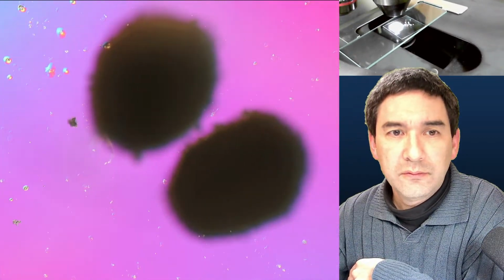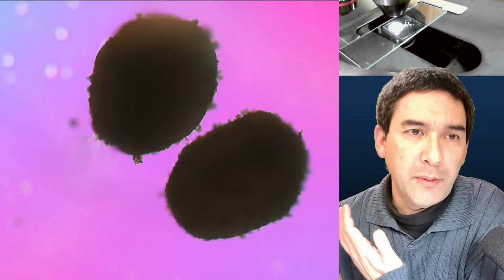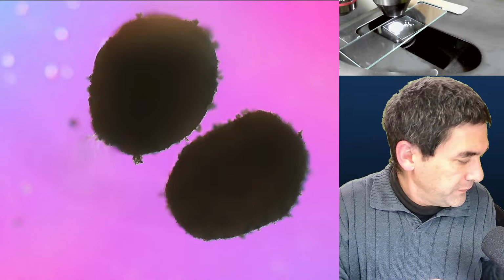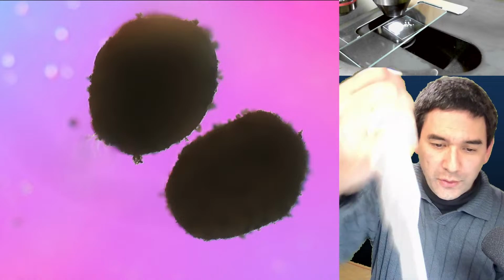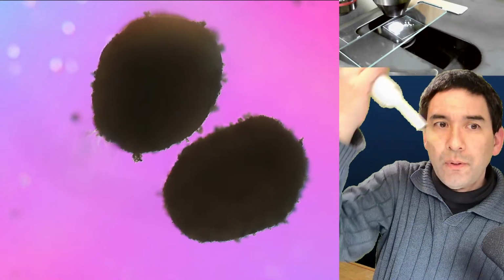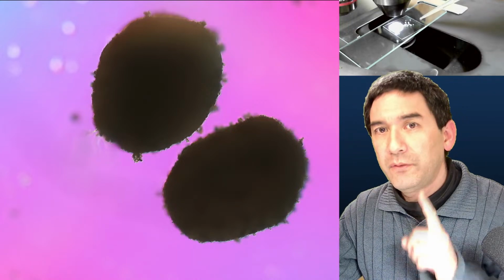And you're able to see those things here, okay? And this is basically how the powder looks. And then let's add a little bit of some of the liquid here. Now in this case it's not so important whether it contains the soap or not, because there's a cover glass on top anyway. So, okay, and I'm going to now add a little bit of the liquid. You can check on top.